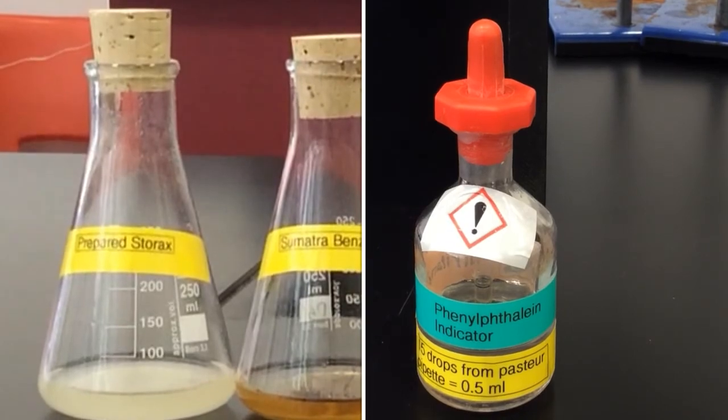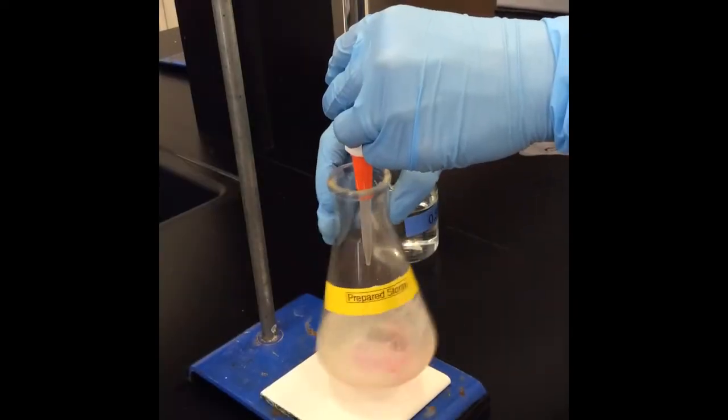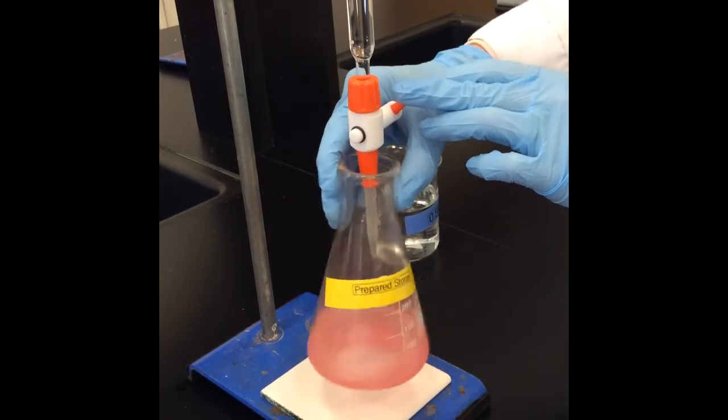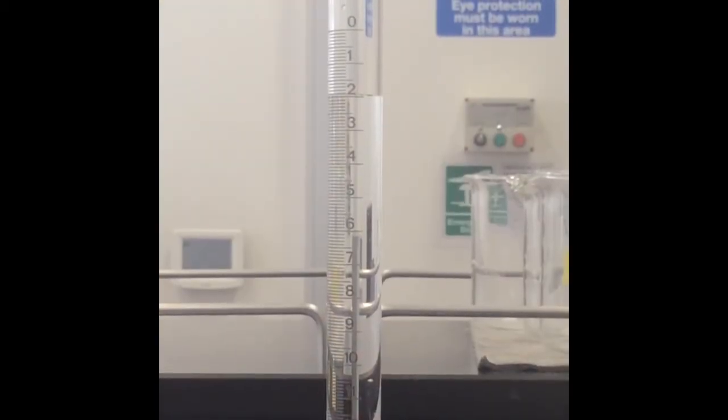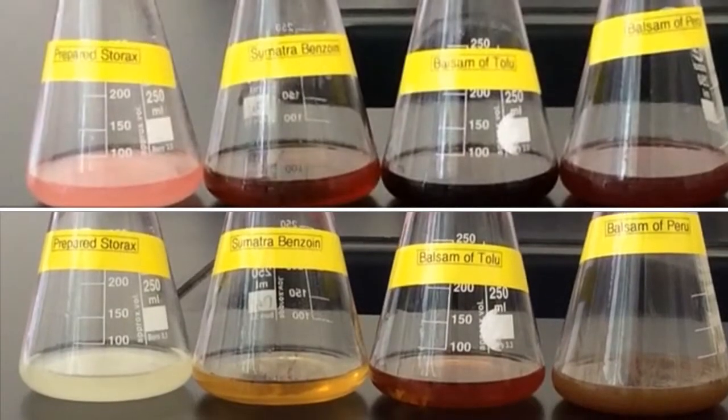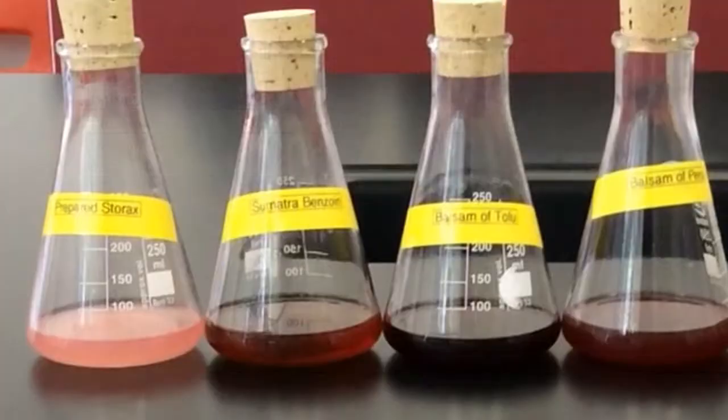The same procedure was used with the prepared storax. The titration with the prepared storax is much more clearly visible as the white to the pink is very clearly indicated. Here you can see clearly the difference between the before and after titration.